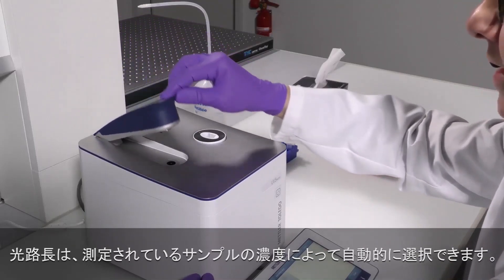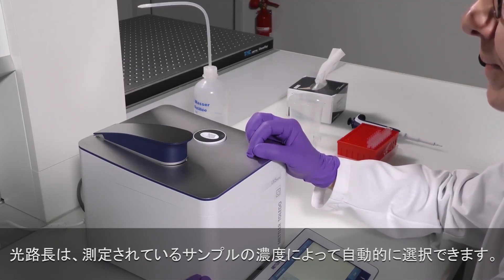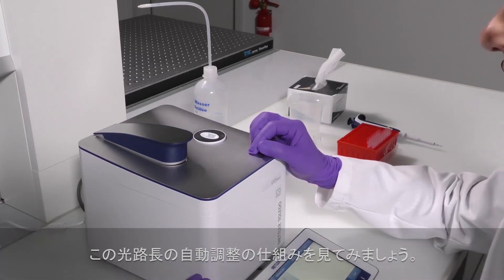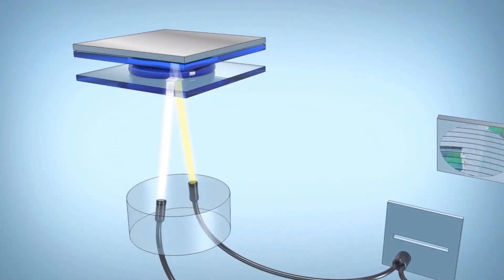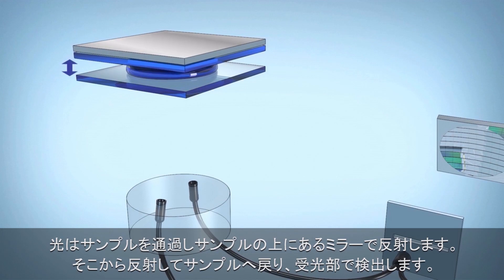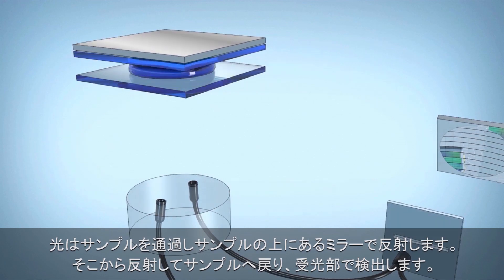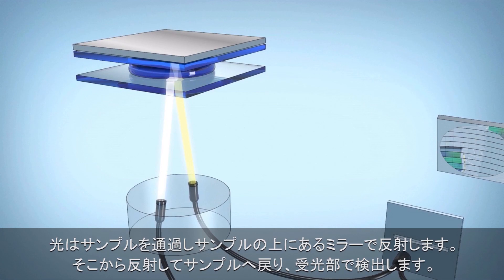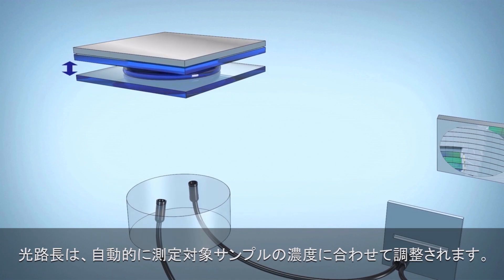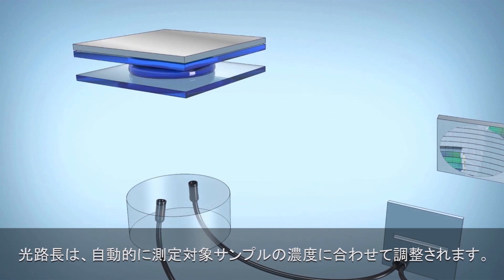The path length itself can even be selected automatically according to the concentration of the sample being measured. Let's have a quick look at how this automatic path length adjustment works. You see in this animation that the light during a measurement comes from below, it passes through the sample, is reflected by a mirror on top of the sample, and from there reflected back through the sample, and then guided to the detector of the instrument. As you can see in the animation, the path length automatically adjusts to the concentration of the sample being measured.